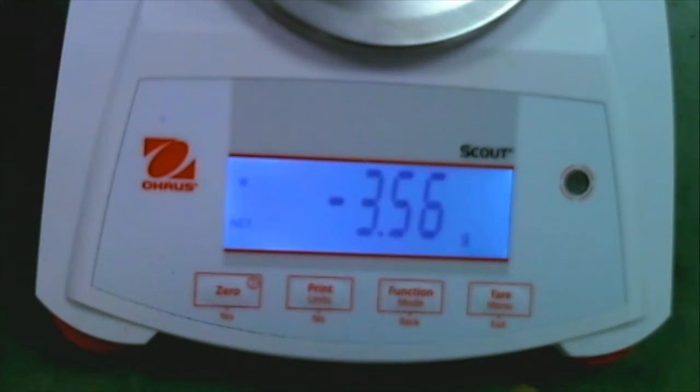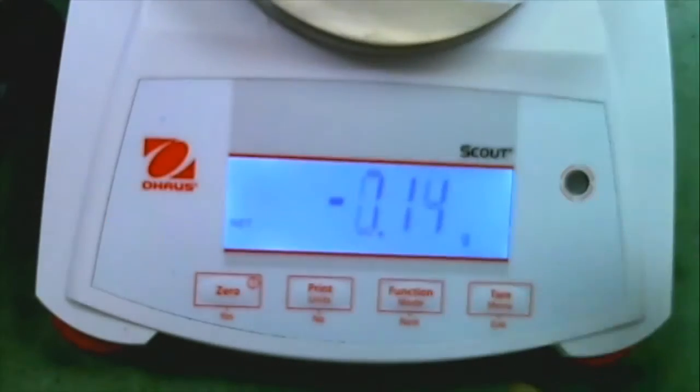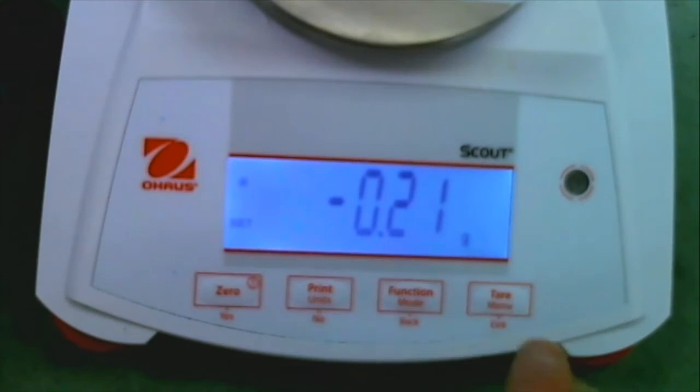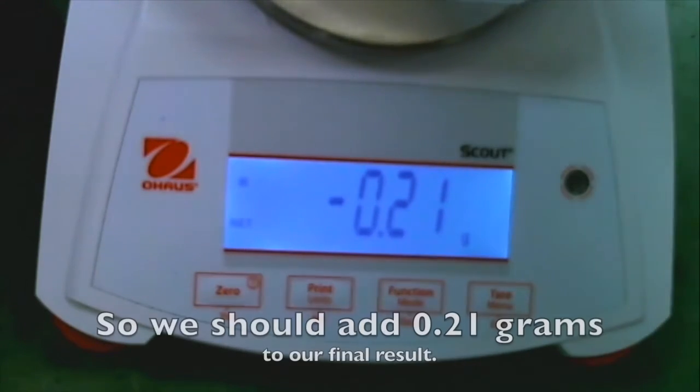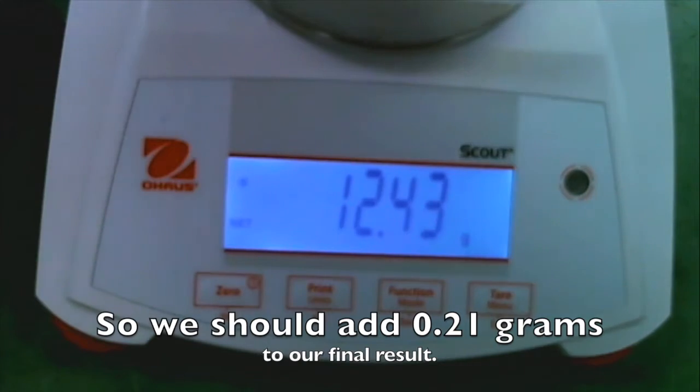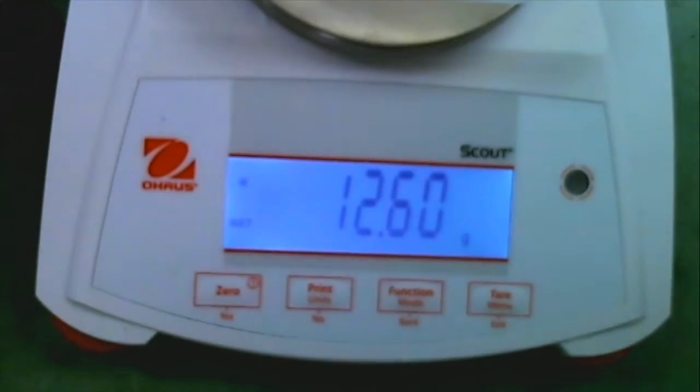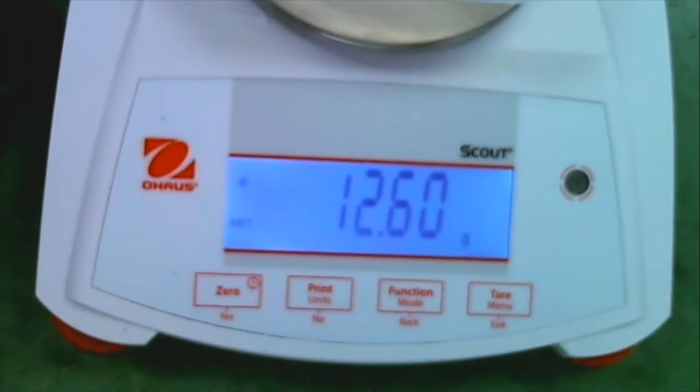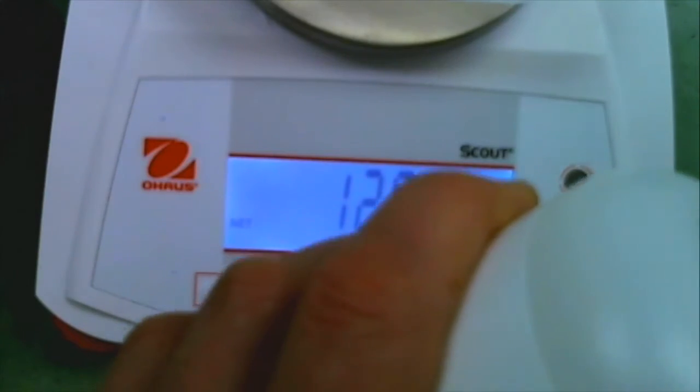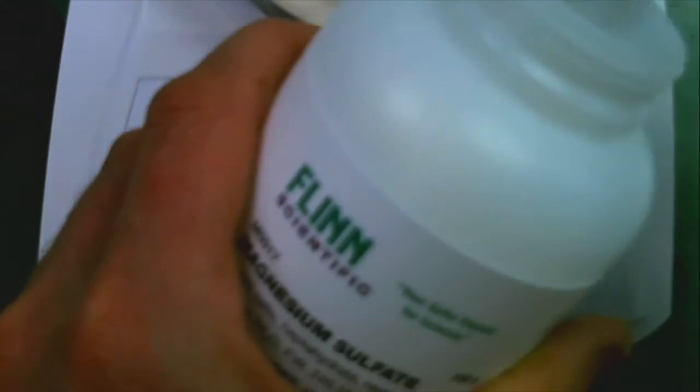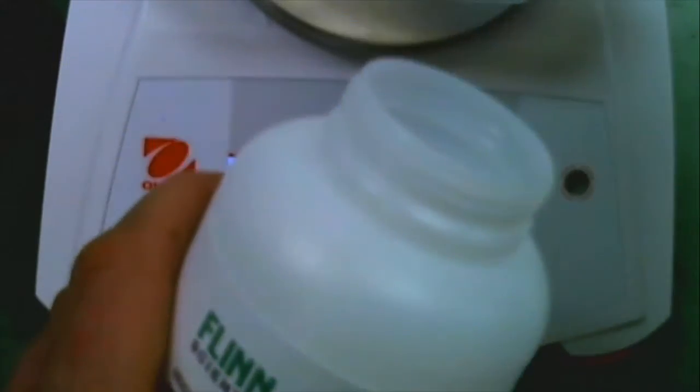We want 24.65 grams, so quite a lot. Let's go.